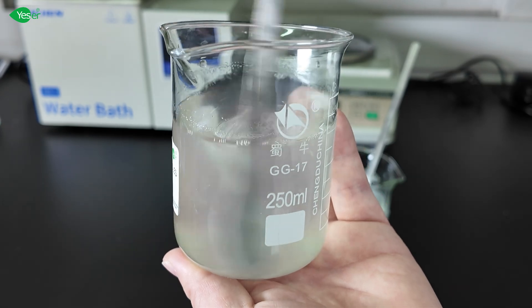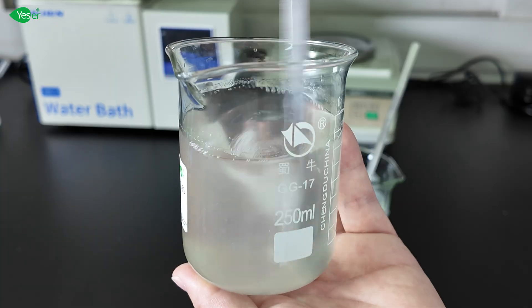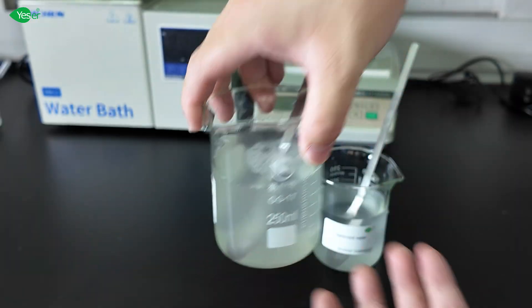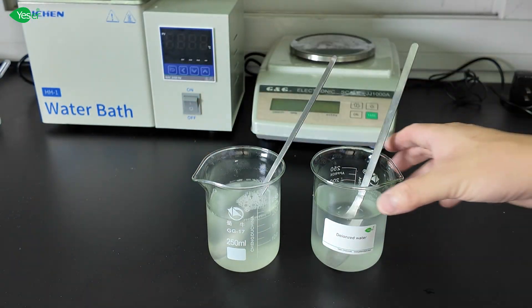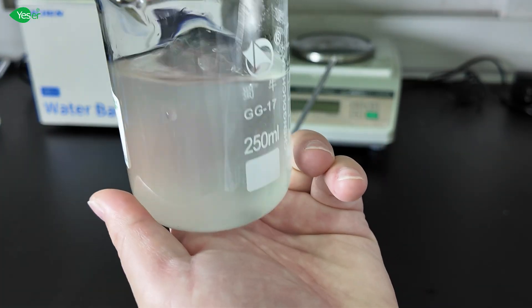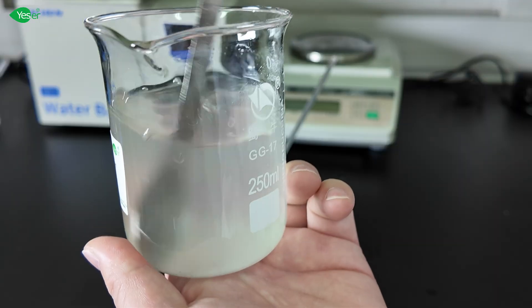Now this one, in this surfactant solution, we don't see any clumps forming. Also, in this water, in this deionized water, there's no clumps.